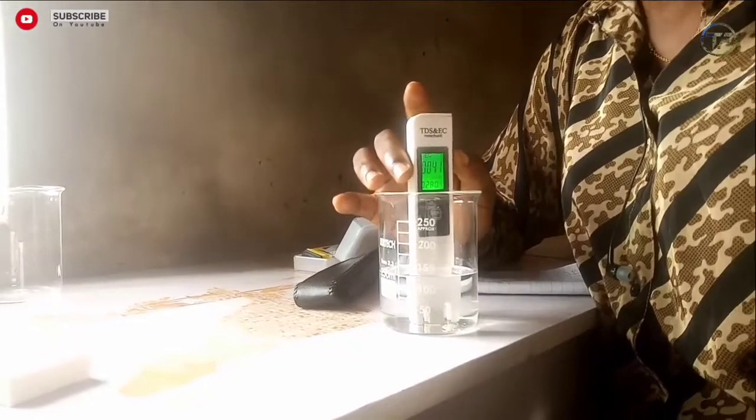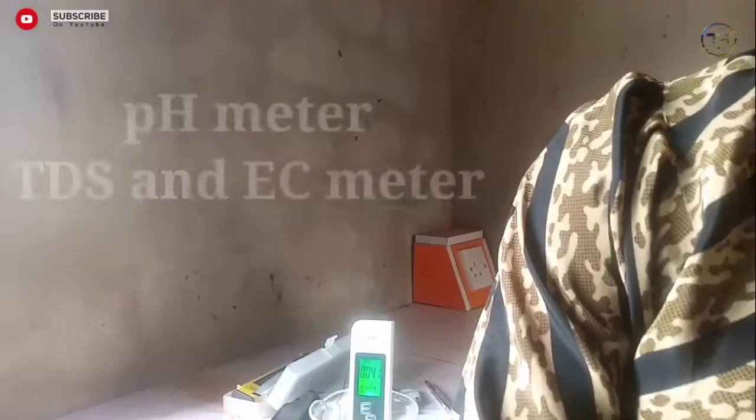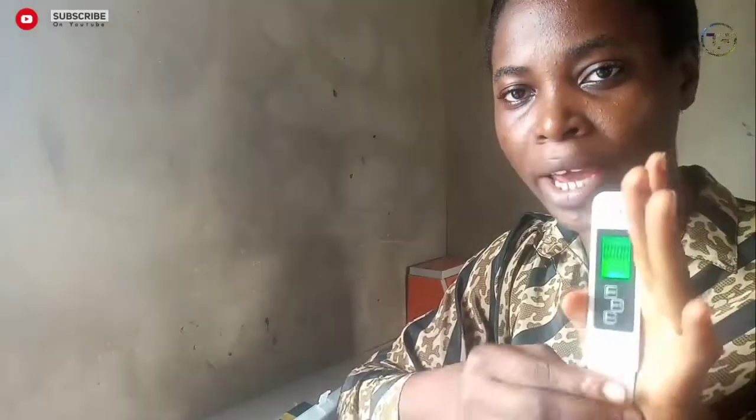I just wanted to show you guys how you can get all these measurements done. For those who are always wondering if they need to go to the lab all the time — you do not, if you have a pH meter, TDS meter, and conductivity meter like the ones I just showed you. You can measure key parameters right on your hatchery. After taking the meter out, ensure you dry it out, turn it off, cover it, and put it back in the pouch.